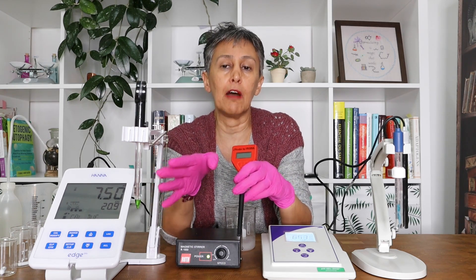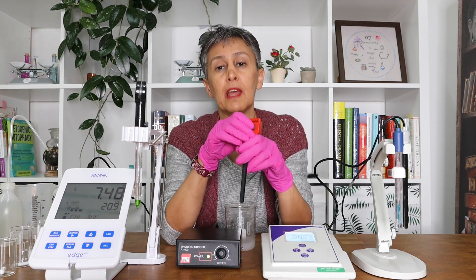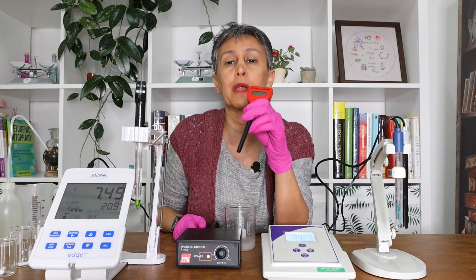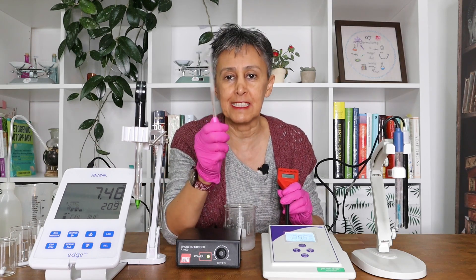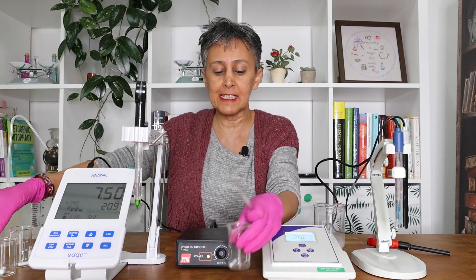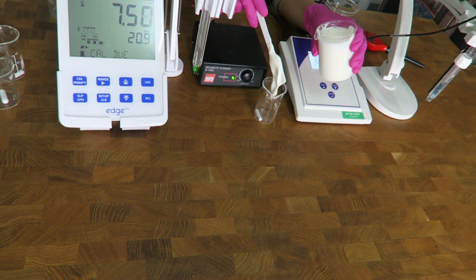What you shall not do with the electrode — for heaven's sake, this is not a stirrer. Do not use your electrode as a stirrer. This is a stirrer. When you want to prepare your samples — I don't have any scales here, I'm just doing it as if there was a scale.